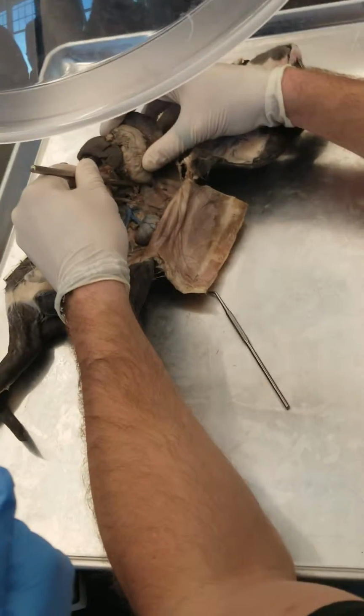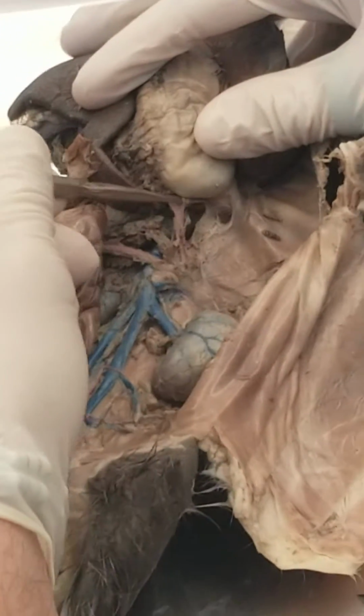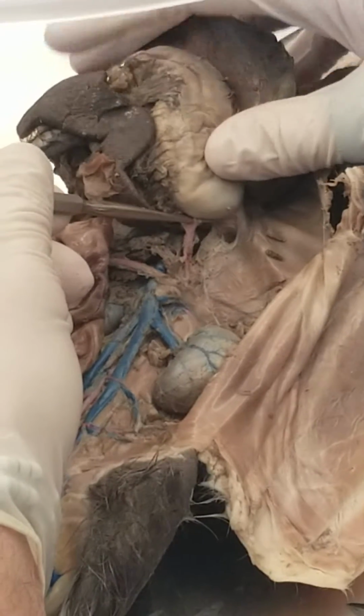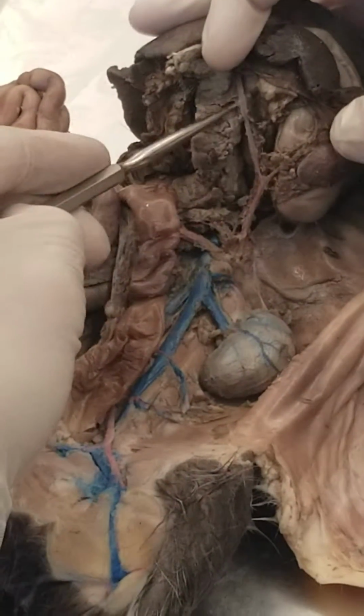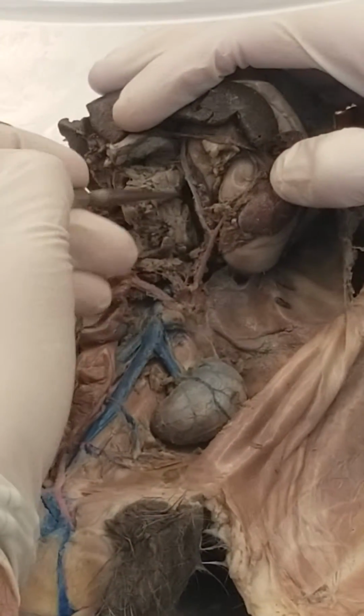Okay. After that, our next branch is going to be at a diagonal, if you're on the right one, and that's your gastric artery, going right here to the stomach. And then lastly, the easiest one to find because it's so dang long, see that right here? It's going to the spleen. That is your splenic artery, right?